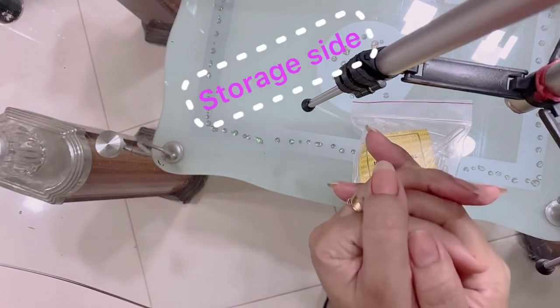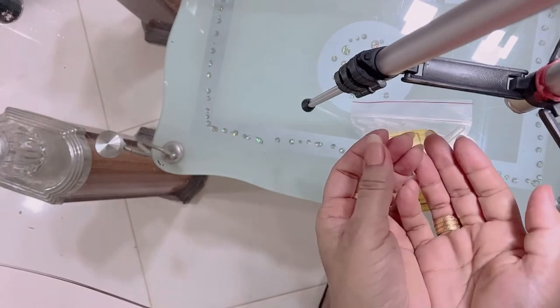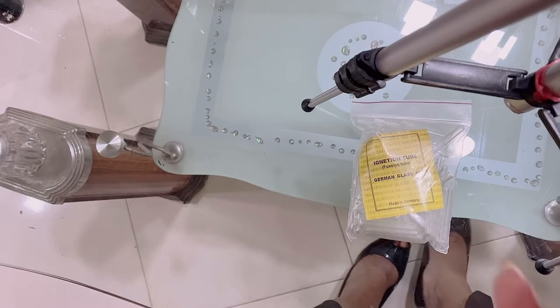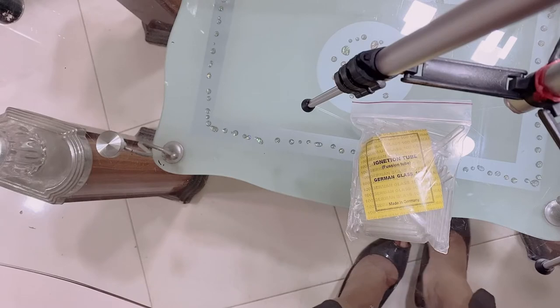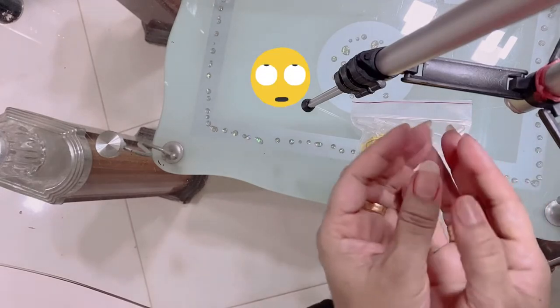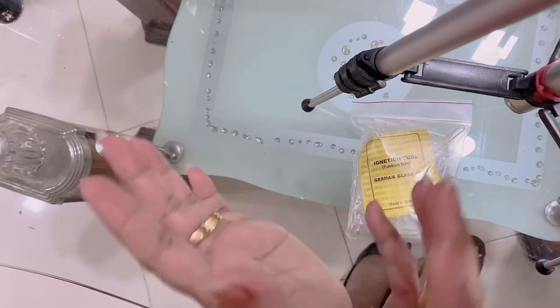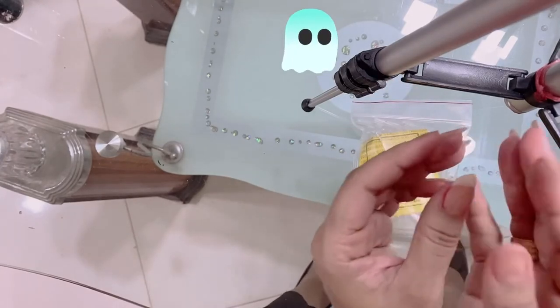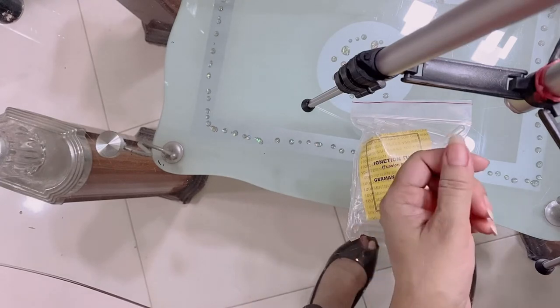Storage is also very important. You need shelves to keep all kinds of glasswares — flasks, titration flasks, conical flasks, beakers, thermometers, and more. A very important part of any lab is your waste container, where you can discard things. You also need containers for glass disposals, biohazards, and trash. These are the basic things a chemistry lab should have.